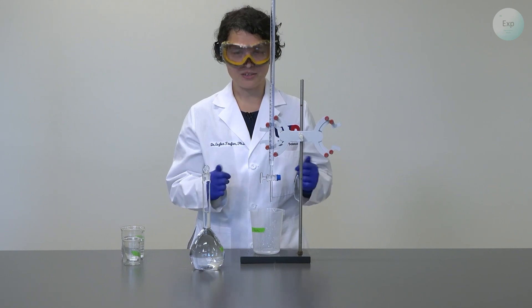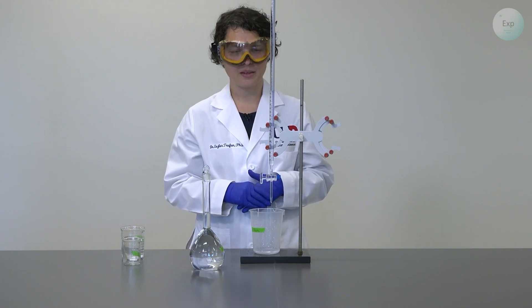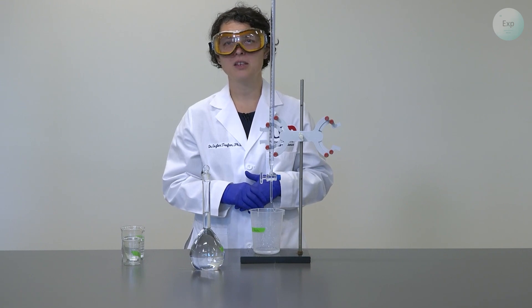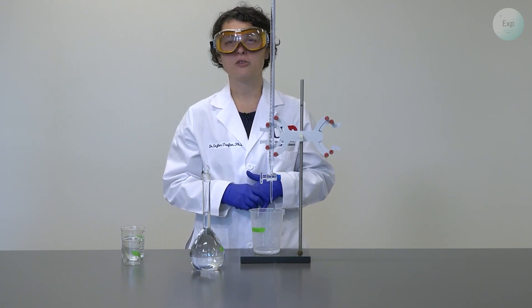And if we are not sure, we need to try this until we are sure. The rinsing with the water should happen approximately three times to consider the burette rinsed.